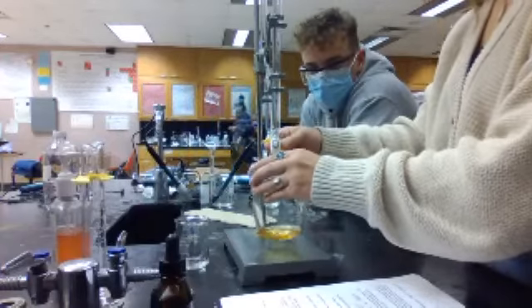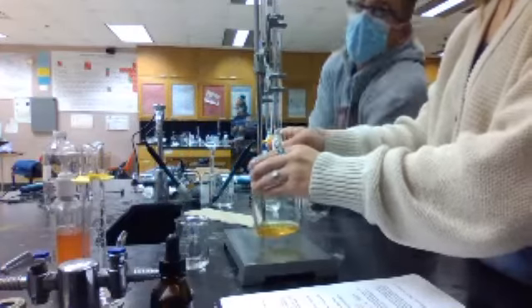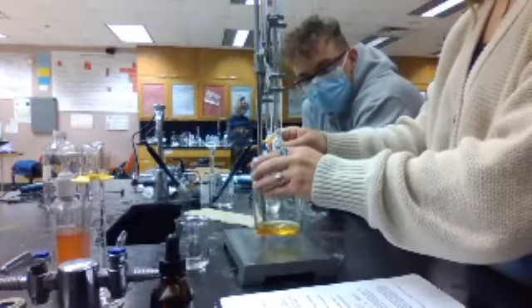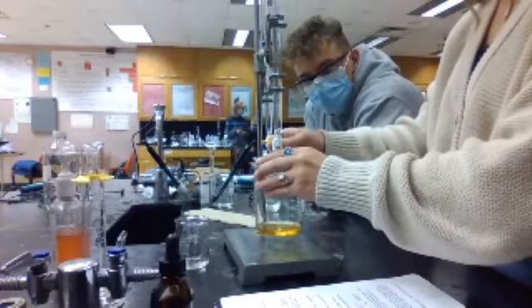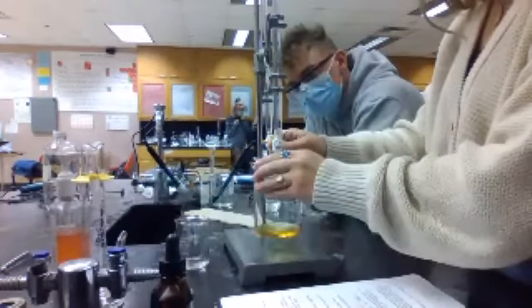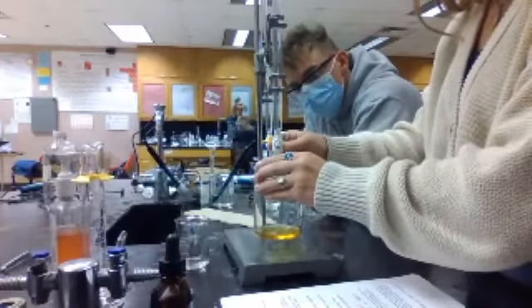Do we trust their math? Okay, it's staying blue a little longer, so maybe you want to go drop by drop. Can you get it to drop? A little more. Too much. Finicky thing, isn't it?